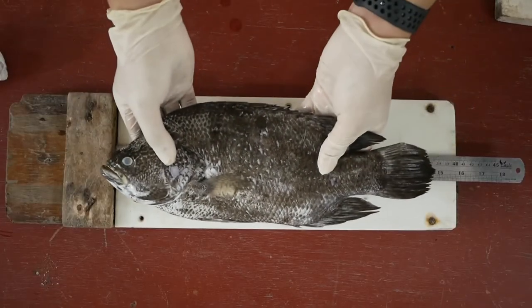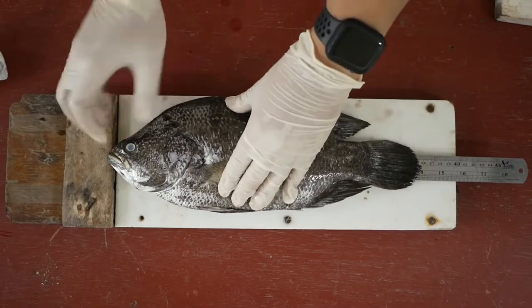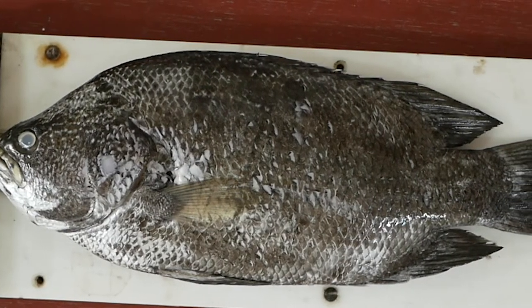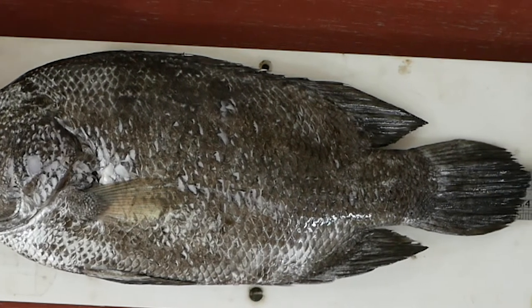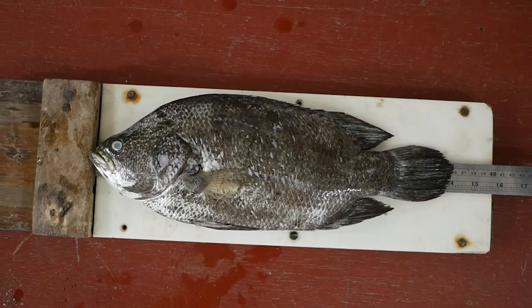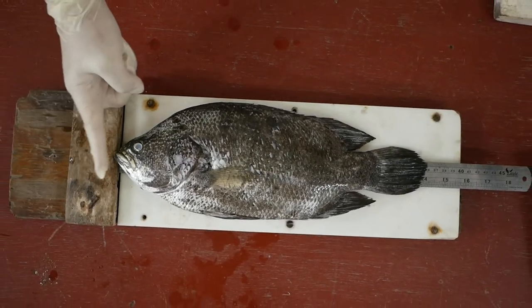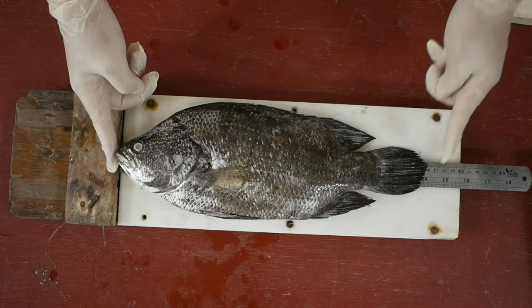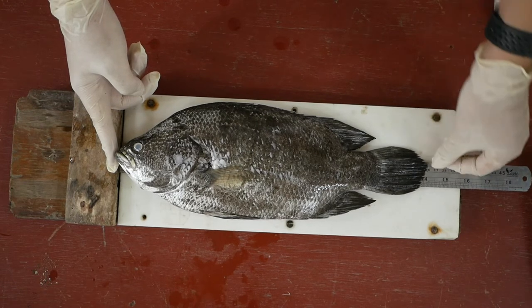For length measurements, you have to first lay the fish flat next to your measuring tool. Generally, length measurements are made with a fish lying on its right side, snout to the left, on a measuring board consisting of a wooden or metal base carrying a center scale, and a head base or nose block against which the snout is gently pressed. The mouth is closed, then the fish body and tail are straightened along the midline and the reading is taken from the scale.